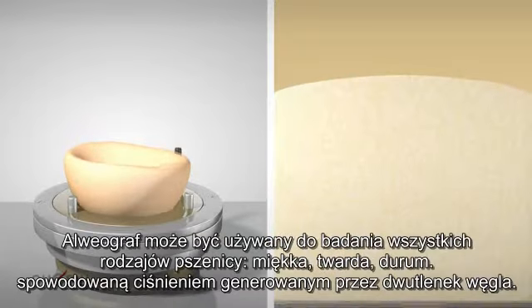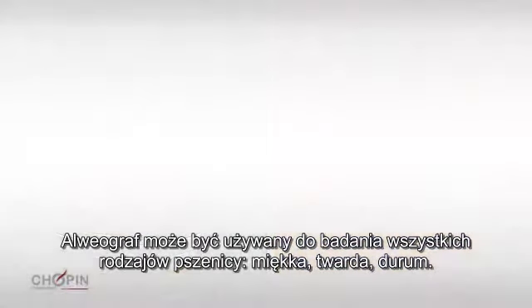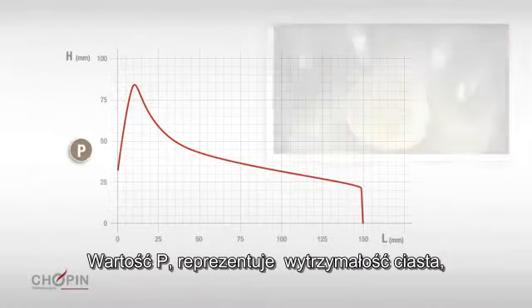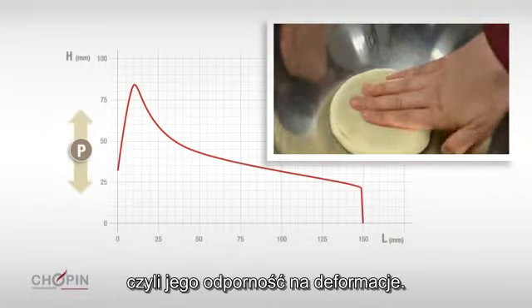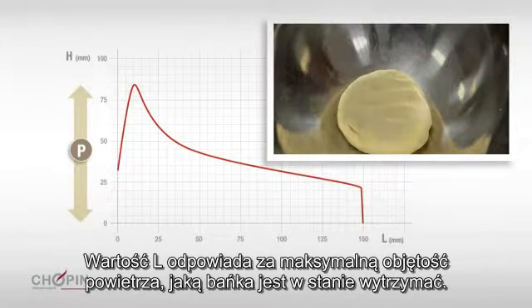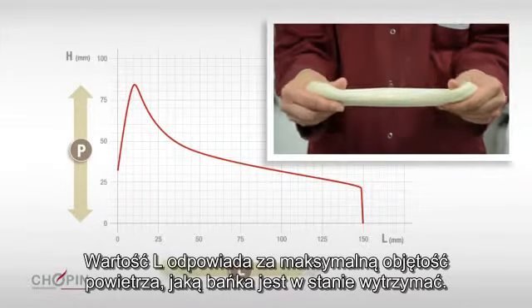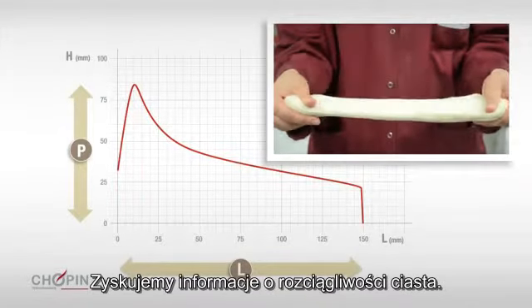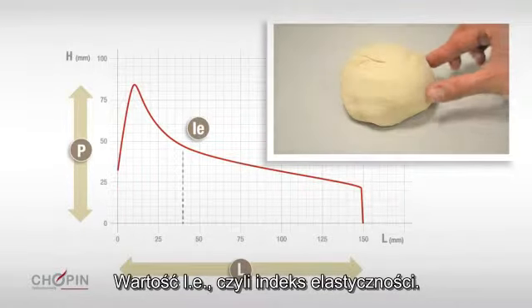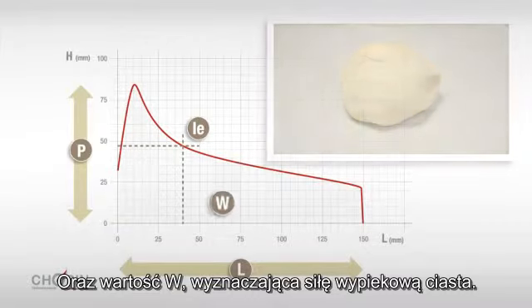The alveograph can be used to analyze all types of wheat: soft, hard and durum. It provides four key measurements. P value represents dough tenacity — its capacity to resist deformation. L value corresponds to the maximum amount of air the bubble is able to contain and represents dough extensibility. IE value corresponds to the elasticity index. And finally, W value indicates dough baking strength.